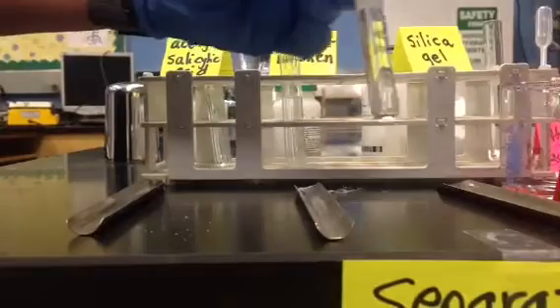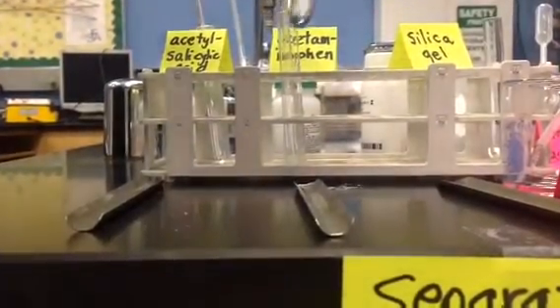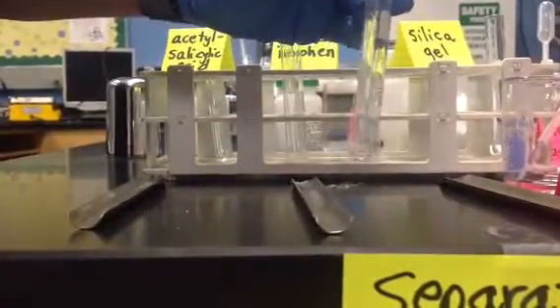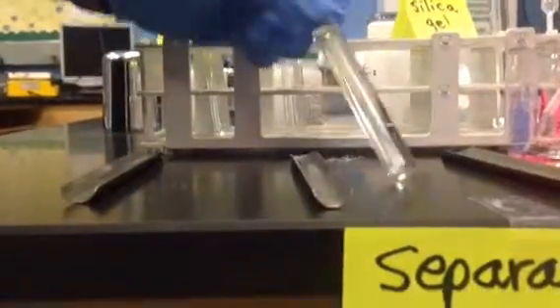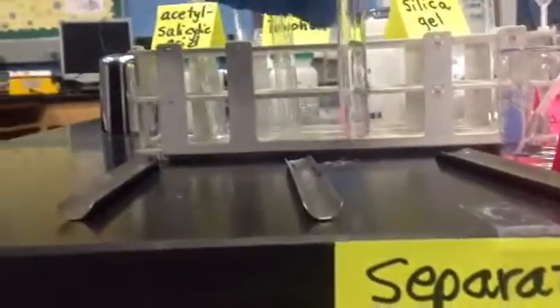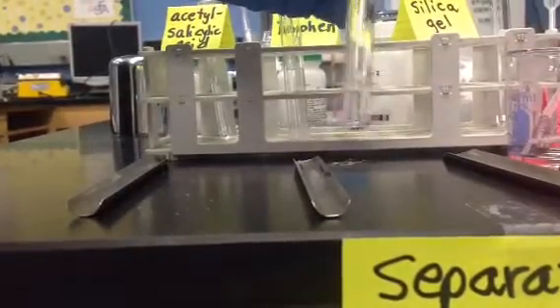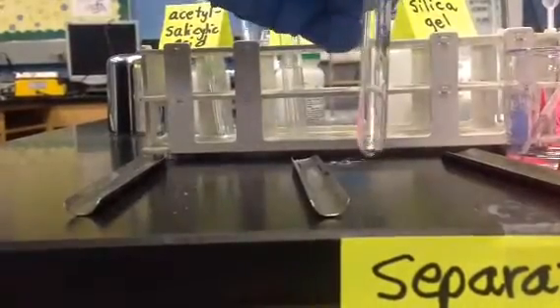And just let's see if we can get it all to dissolve. I think we did it that time. Do you see any of the particles at this point? So we just had to really put enough solvent in there to dissolve it. So you may have to use more solvent than you saw me use here, or that you used when you tried the introductory experiment today.